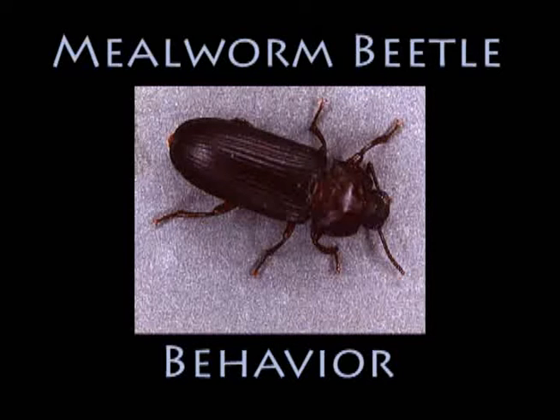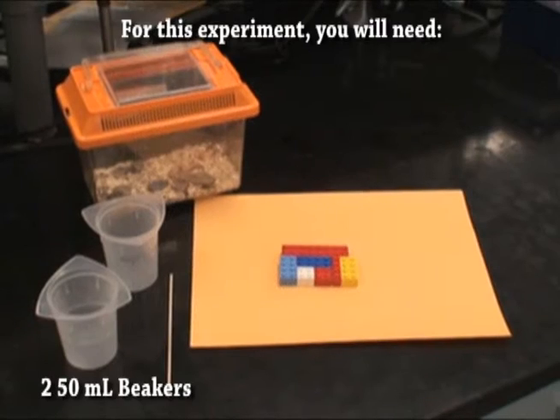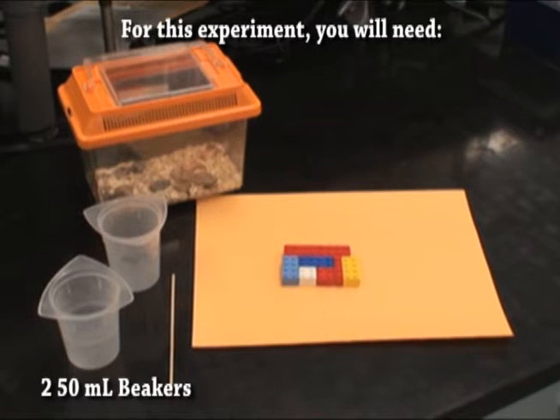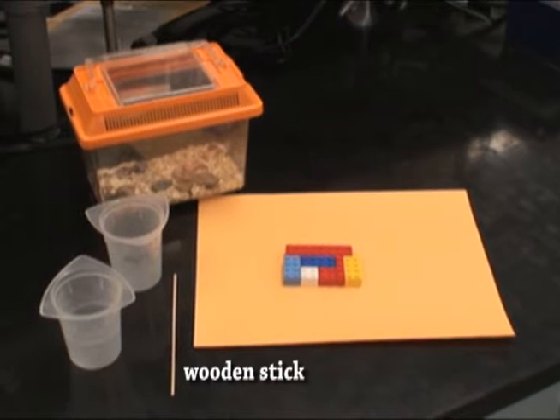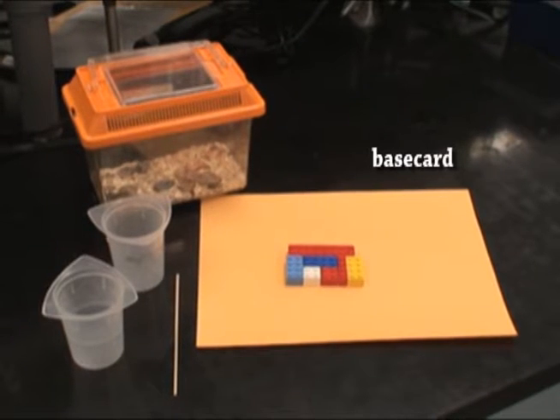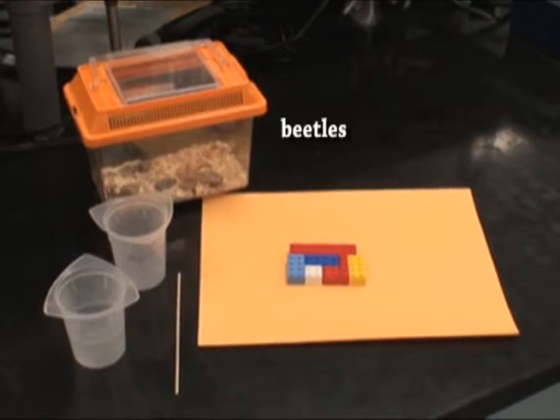Mealworm Beetle Behavior. For this experiment, you will need two 50ml beakers, a wooden stick, a base card, Legos, and beetles.